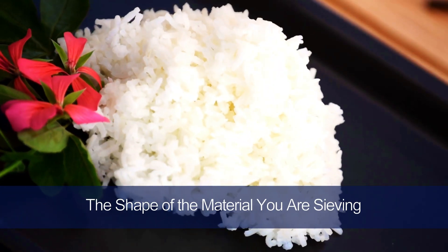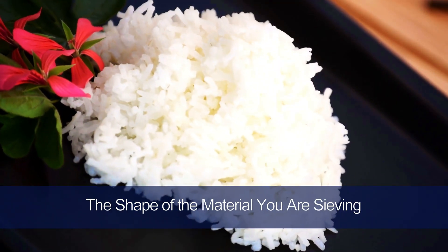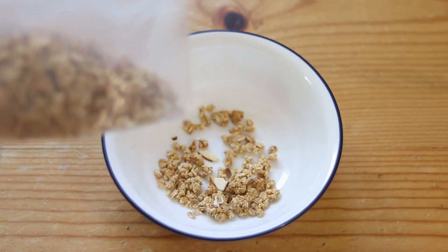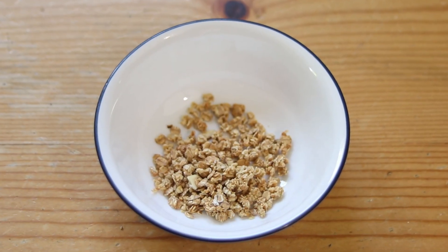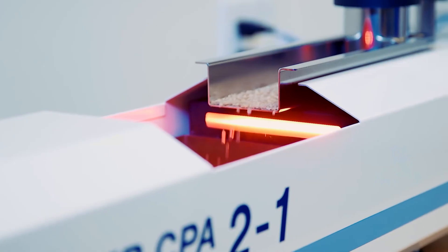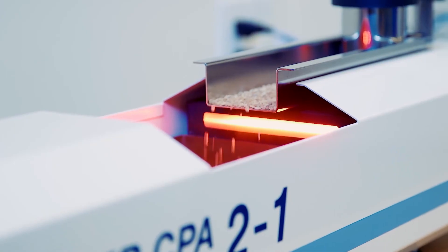Material with a high aspect ratio, like rice, or material with a flat, irregular surface, like cereal, are tough to sieve and obtain repeatable results. This is why it's important to employ the correct equipment to carry out the process. If irregular particle shapes are causing issues for your operation, a dynamic image analysis system may be a good solution.